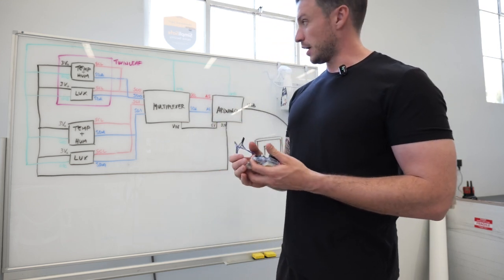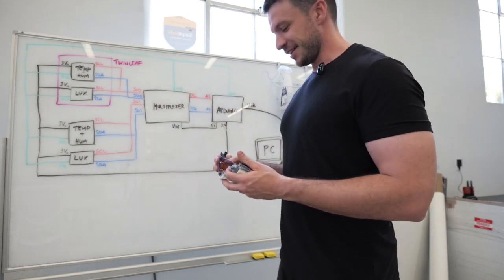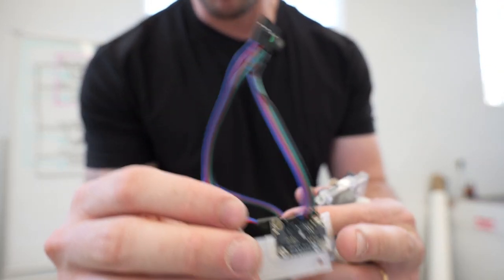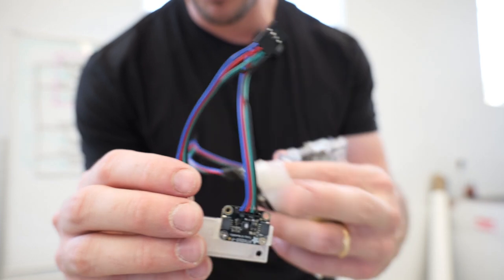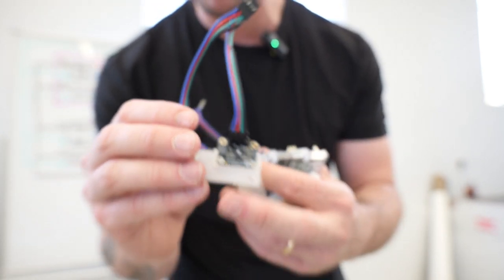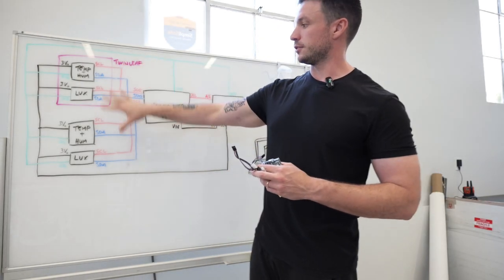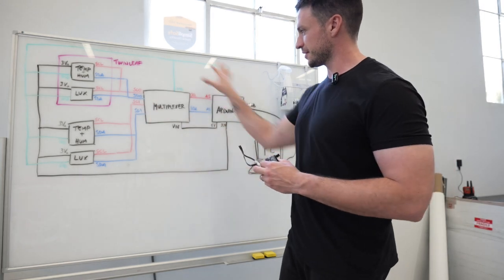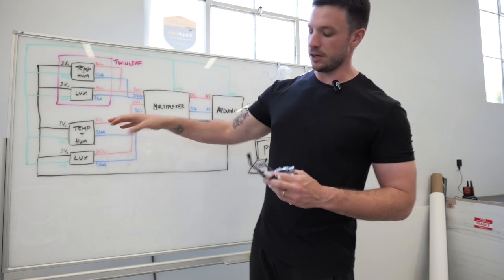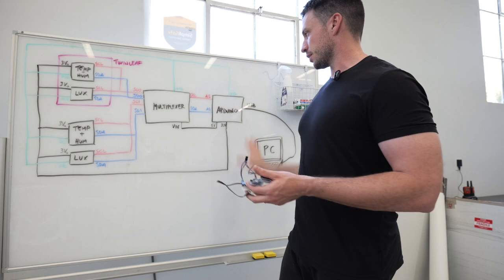And so I made this scheme mostly for me to figure out the wiring, and as you can see, I made a bunch of custom-made wires. I built these yesterday, and they are black, green, red, and blue. And so I used basically the same coloring to go over this scheme so that I know how to connect them to which pins of the sensors, the multiplexer, and the Arduino everywhere goes.